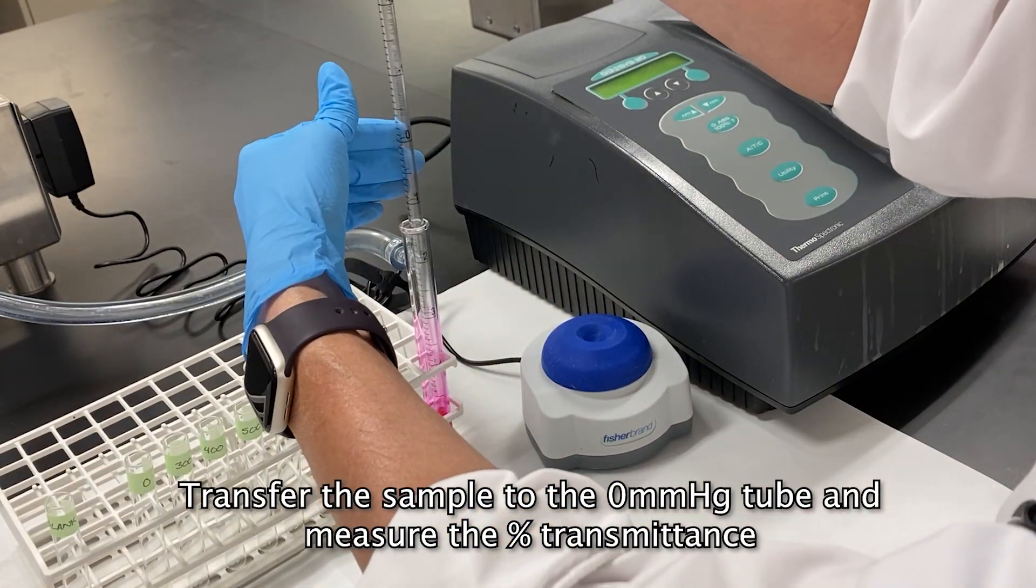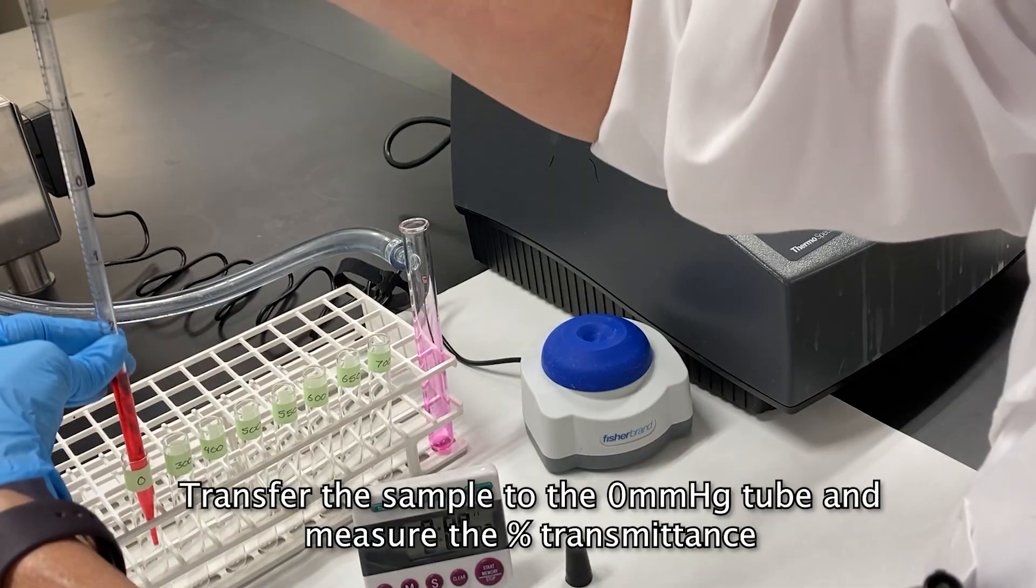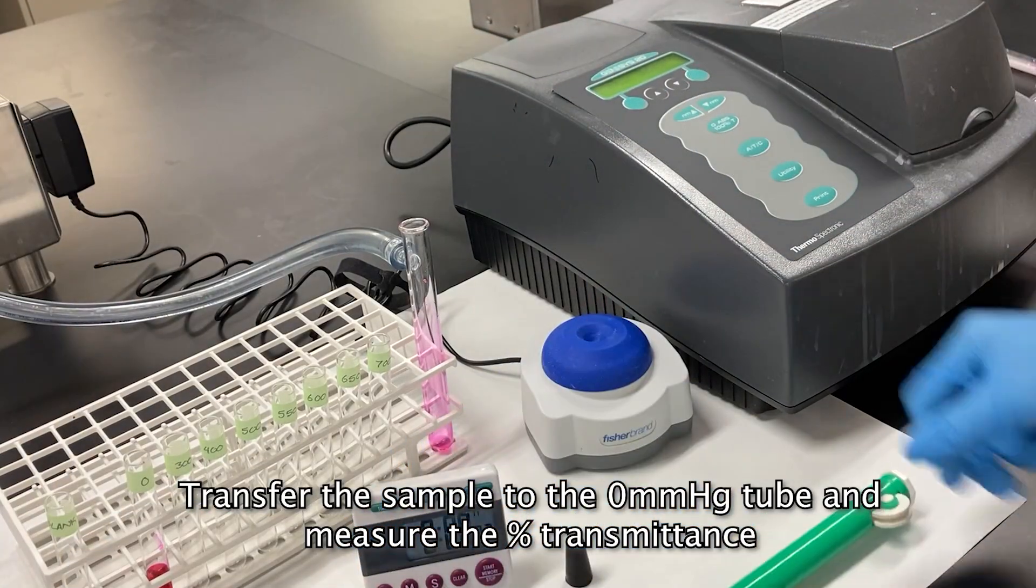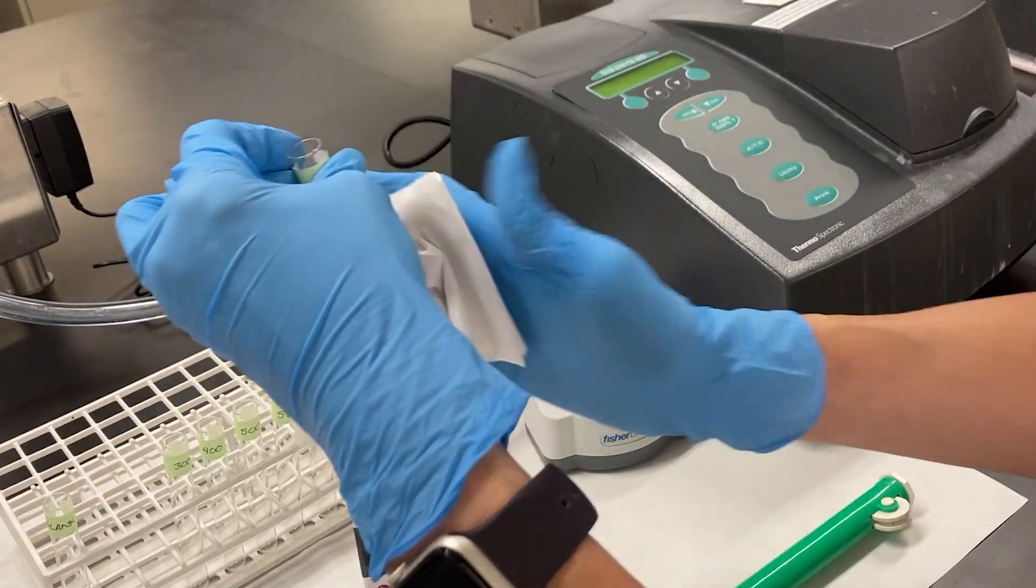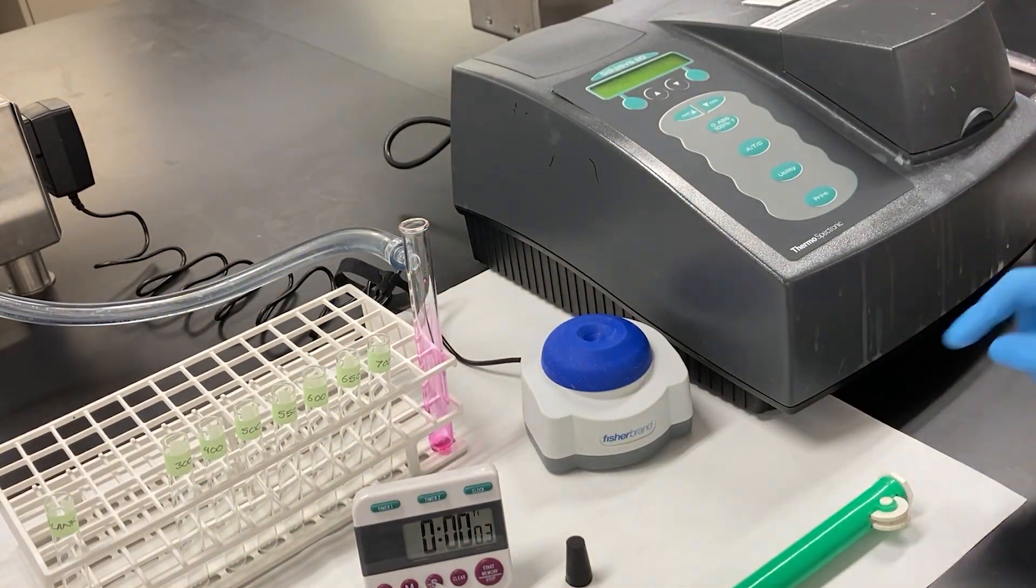Do this quickly and try not to get any air bubbles. Wipe off the tube, place it in the spectrophotometer, and record your reading.